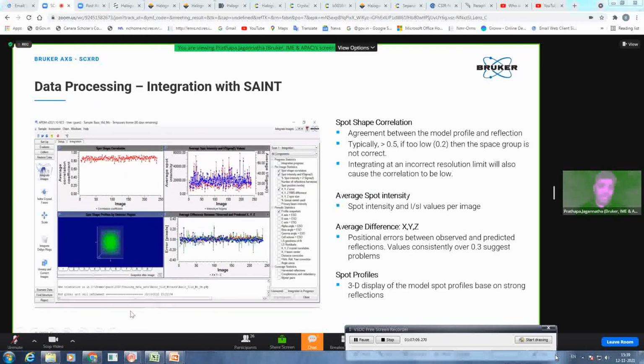Okay, and this is the feedback you get from the integration as soon as you start. There are several graphs to look at, but the most important one we want to see is the average correlation coefficient. That tells you about the agreement between your model profile and the reflection. And typically, if it is greater than 0.7 or 0.8, then consider it good data and you have a better integration.